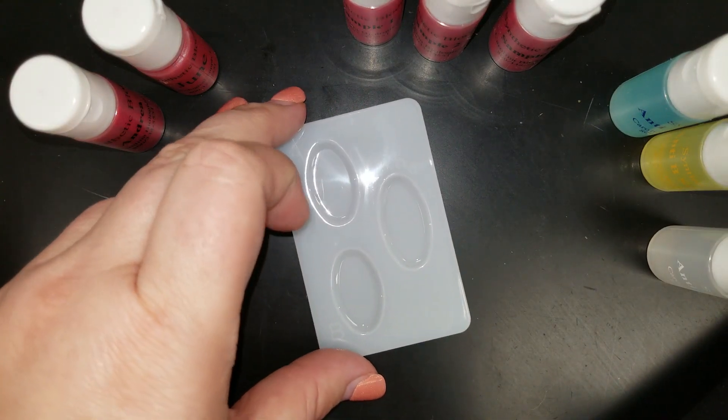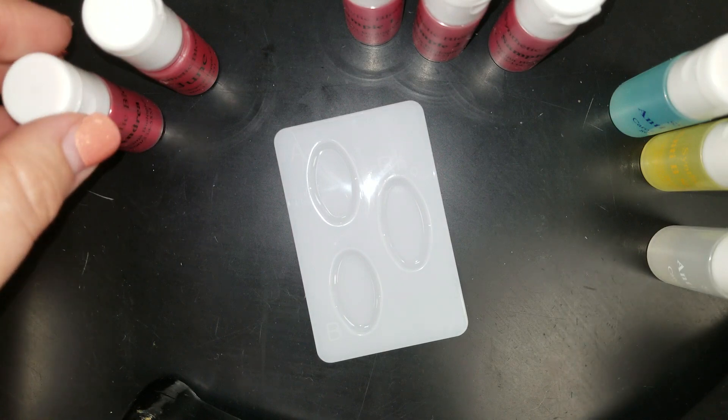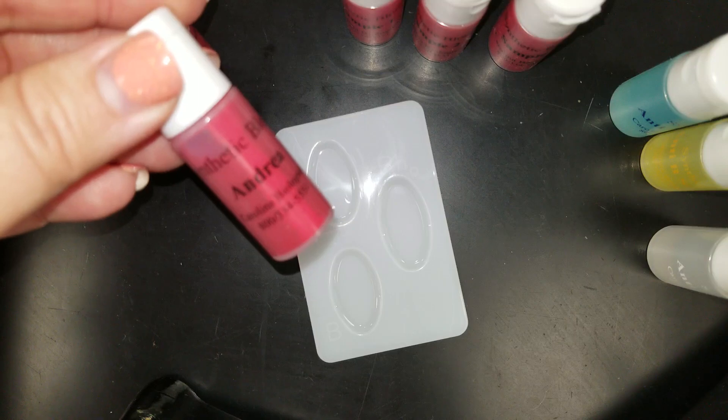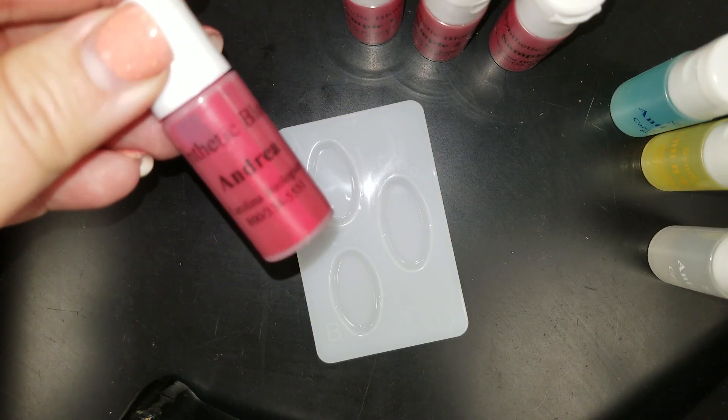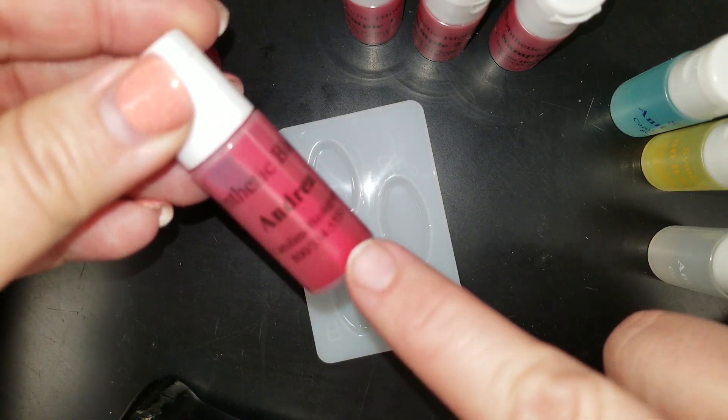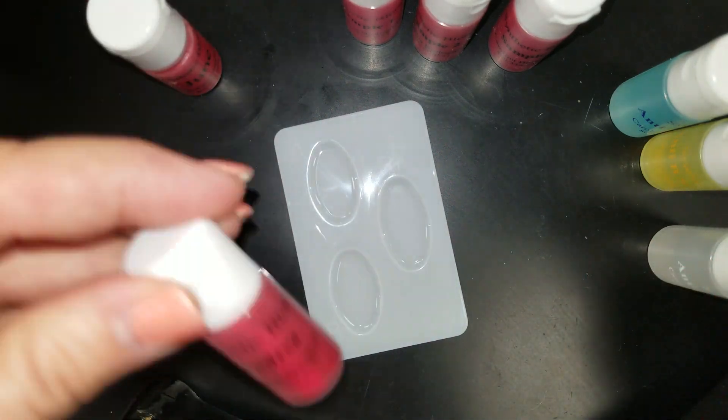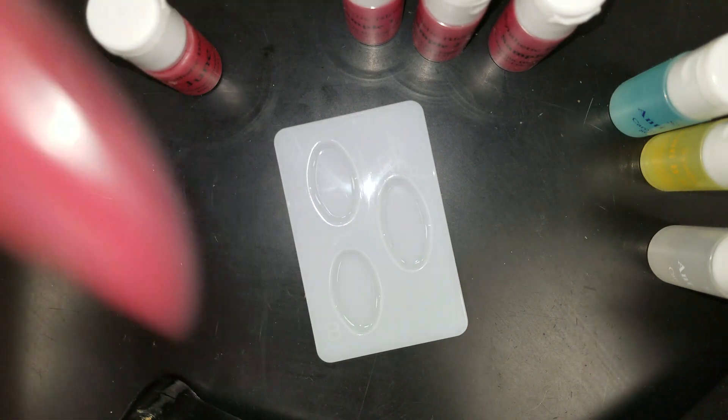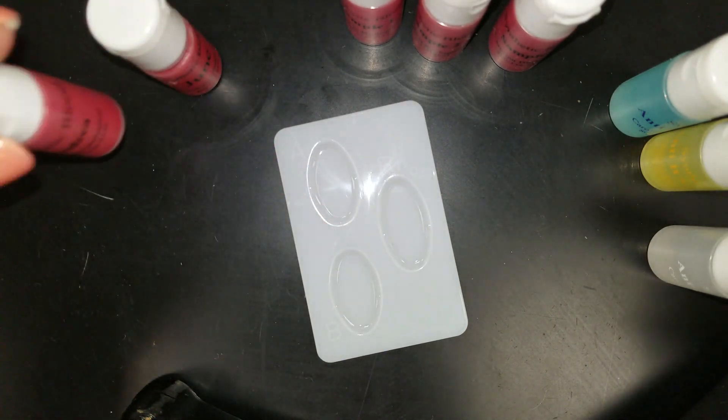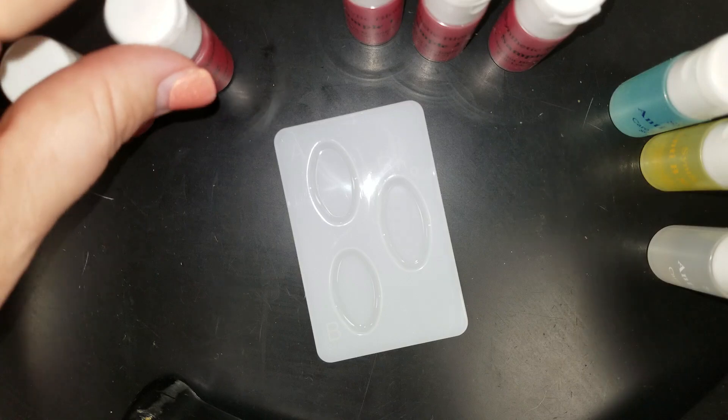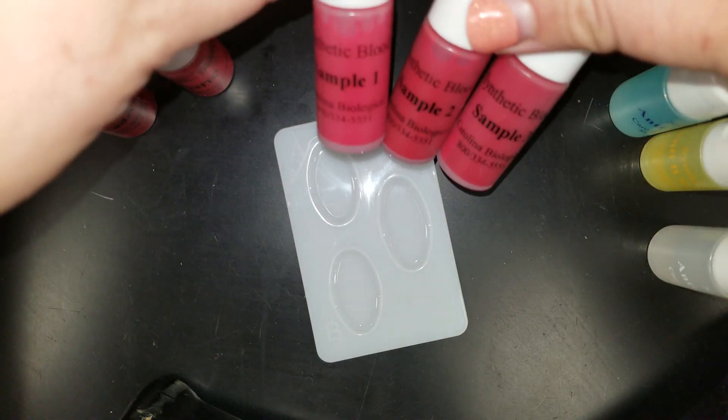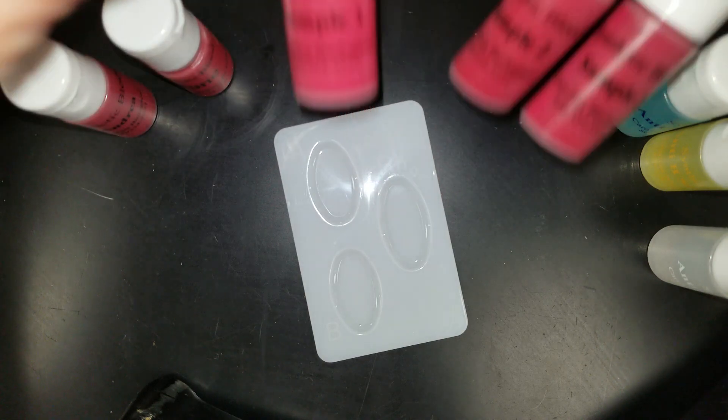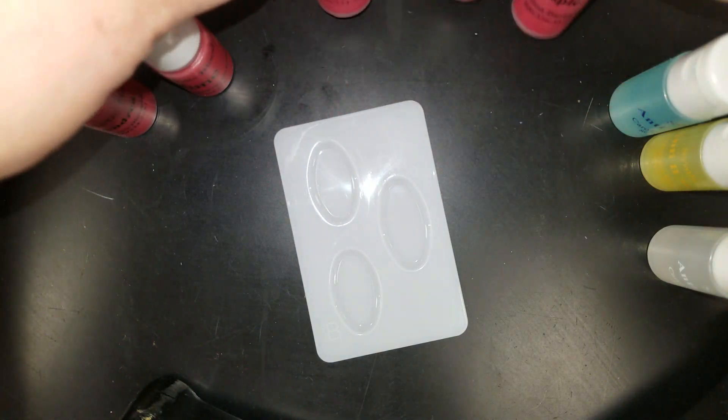At each station, you're going to need to have your five samples of synthetic blood. So this is not real blood, but just lab created. You should have Andrea, and you'll notice that sometimes it sort of separates out. So it's a good idea to give it a good shake before using it. Really get all of that resuspended. So you should have Andrea, June, and then your three potential fathers. They're labeled sample one, sample two, and sample three. And again, make sure you're giving all of these a really good shake.